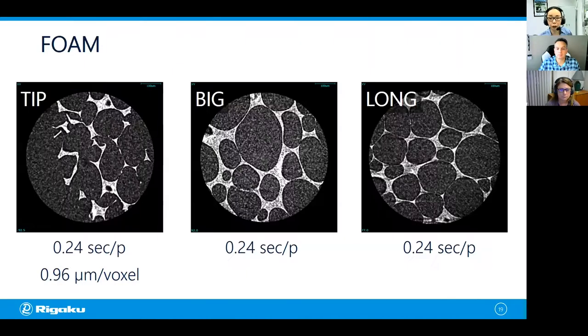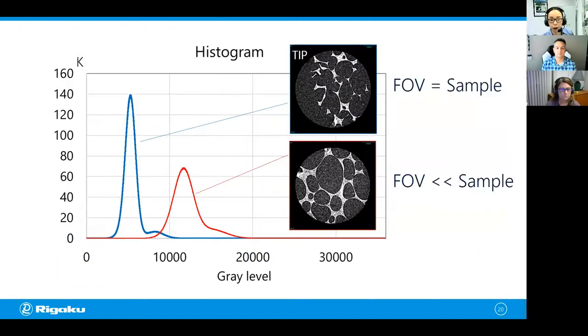So let's compare all three, okay? The first two, a tiny sample and a little bit bigger but not long sample, they look okay, except that the small sample is showing some damage. Now, I don't know if you can see this, it's a really subtle difference, but this tip or small sample scan has a little bit lower noise level than this big sample. If you compare their histograms, you can see the difference a little bit better.